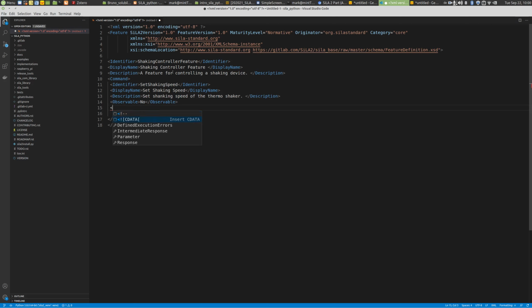Then you should specify the parameter. In this case, we specify the speed.